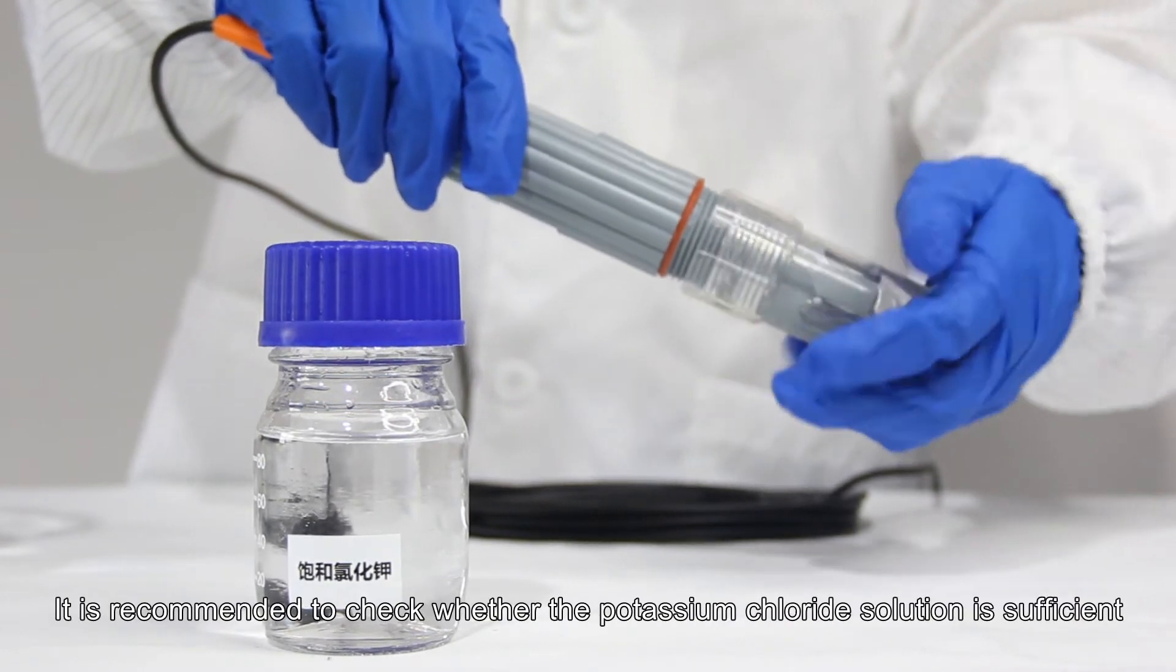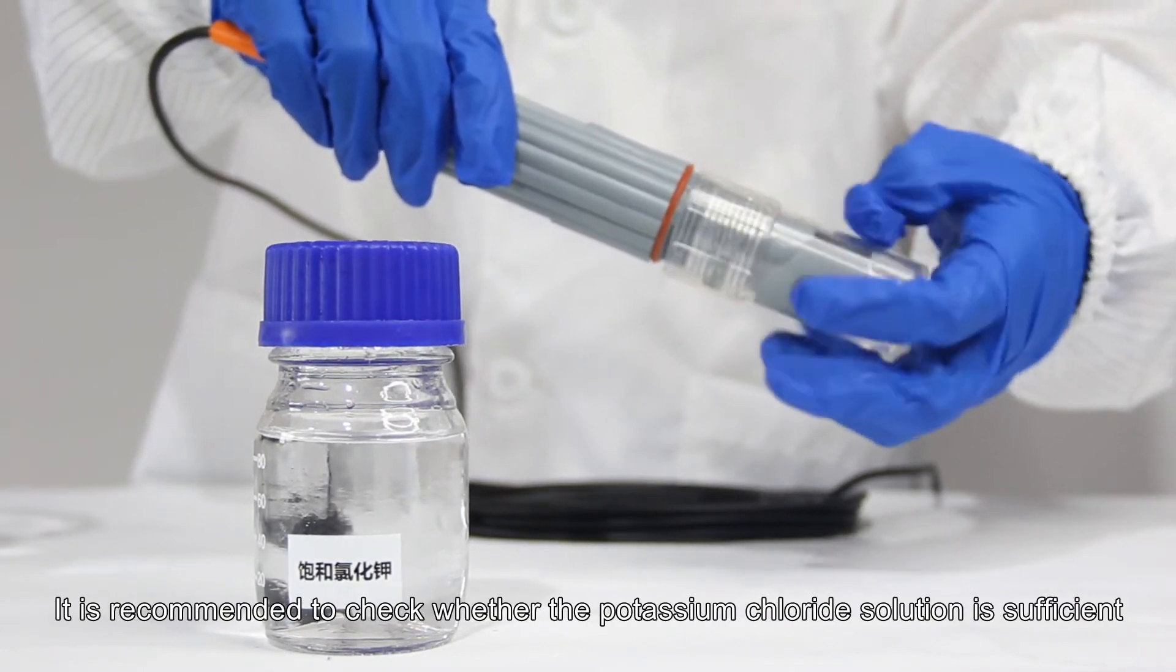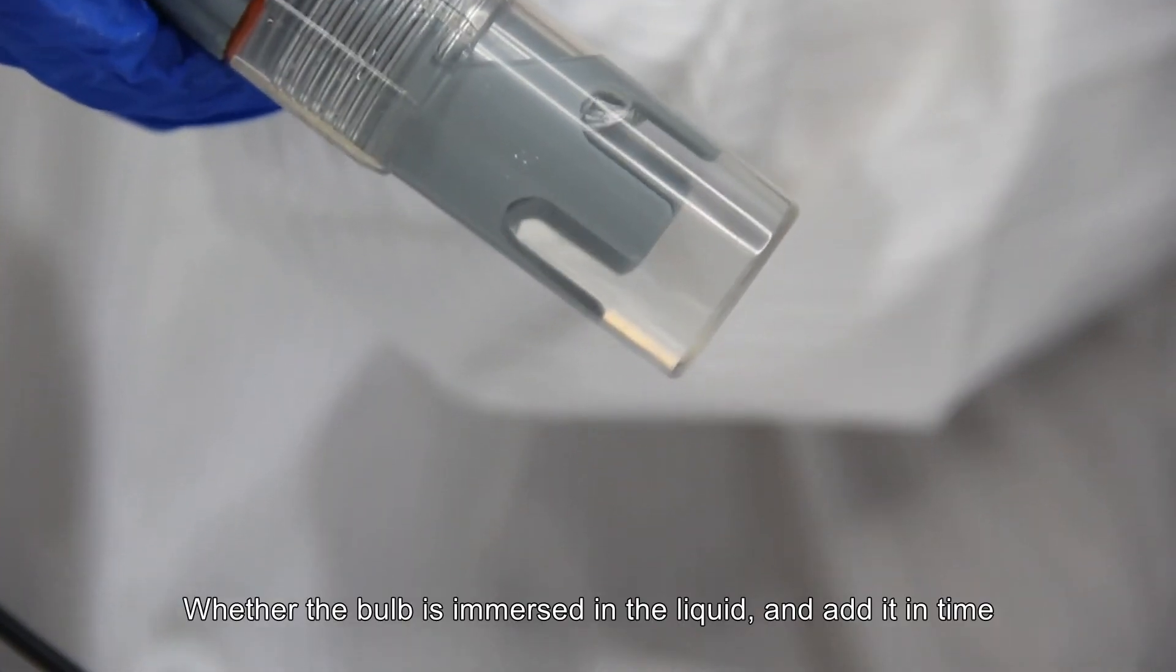It is recommended to check whether the potassium chloride solution is sufficient, whether the bulb is immersed in the liquid, and add it in time.